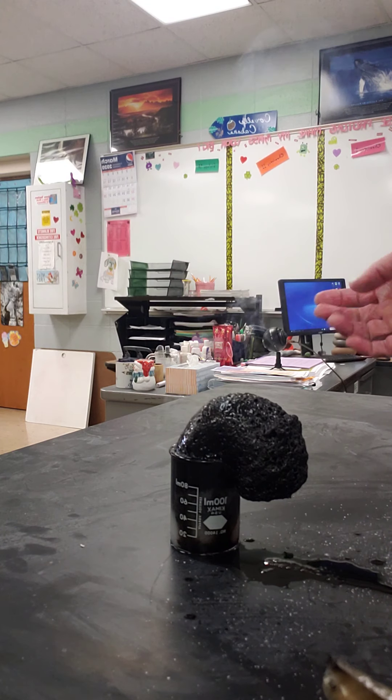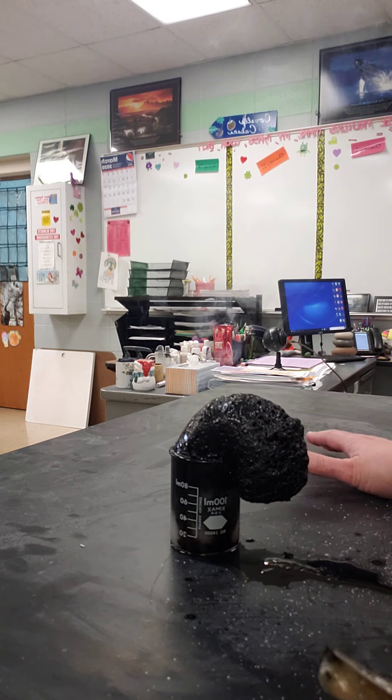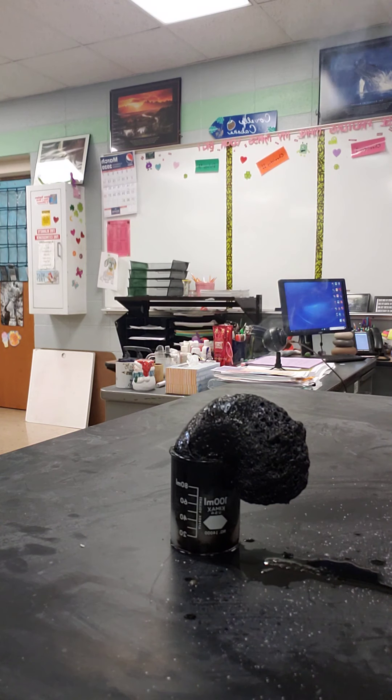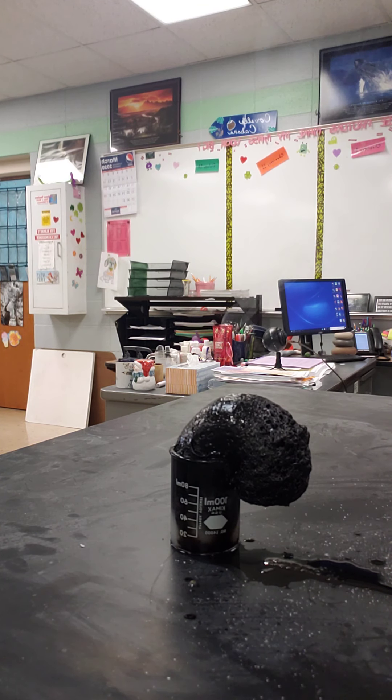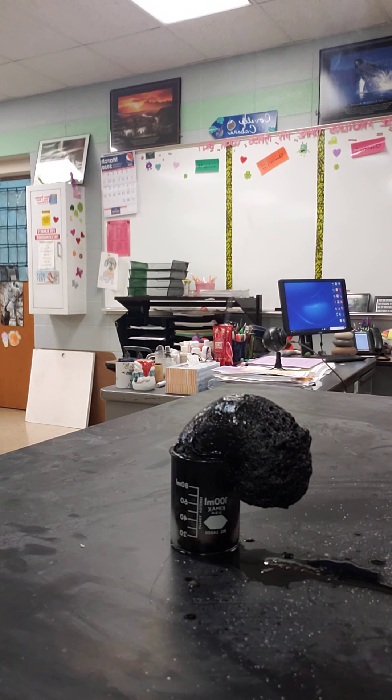And I'm releasing carbon dioxide, water vapor, energy, and there's some pure carbon left over. That was in your sugar. Huh, who knew?